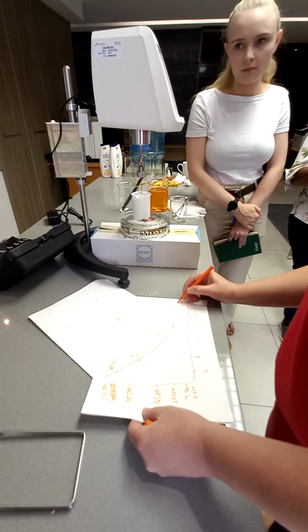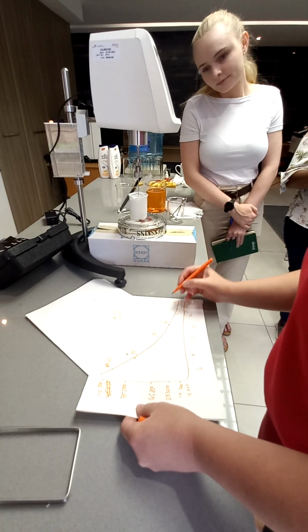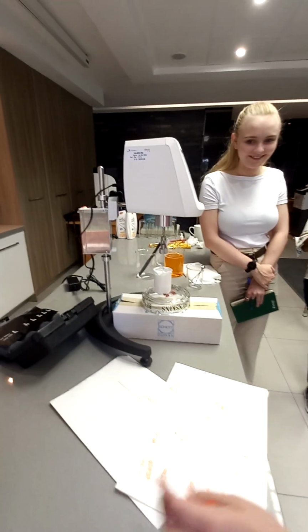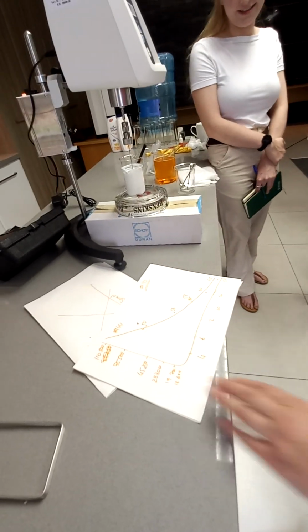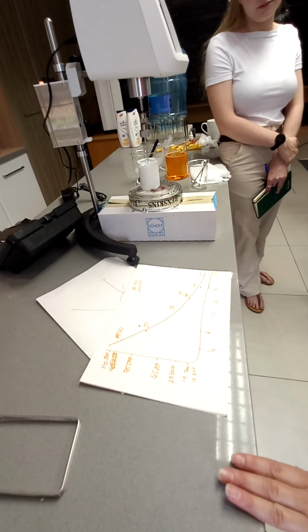That one is 65. Maybe this was 50, 58. Okay, it's just an example. So now I'm going to ask the question again. So what is the viscosity of this? You said any of them, but again, I would choose the 56 because it's closer to 50. On spindle 12. Yeah. Spindle. Good.